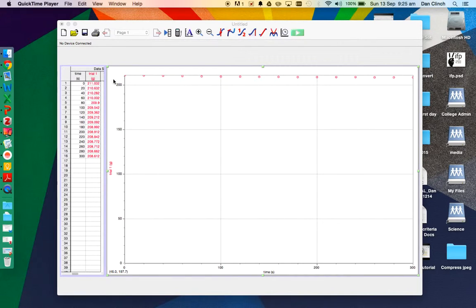So in this video I'll show how to get multiple sets of data to graph on the same axes, which is probably something lots of people want to do at the moment. Logger Pro's looking pretty hopeless and you're probably thinking you want to go back to graphing on Excel.